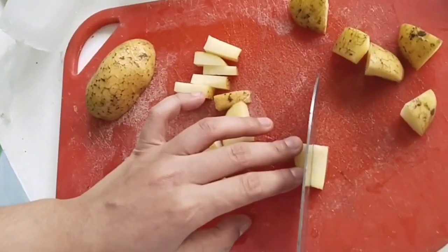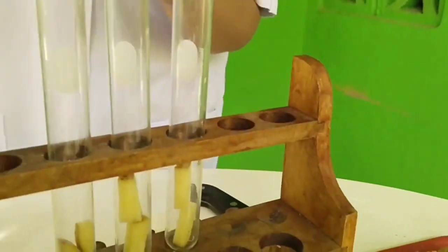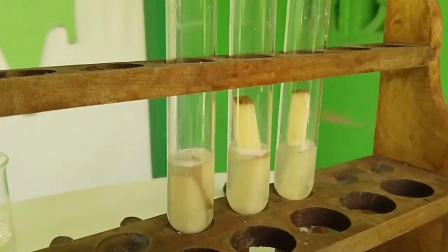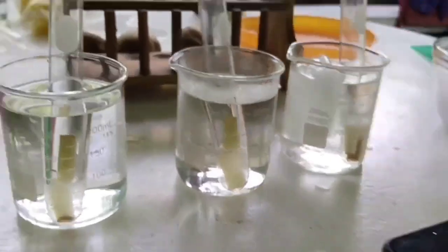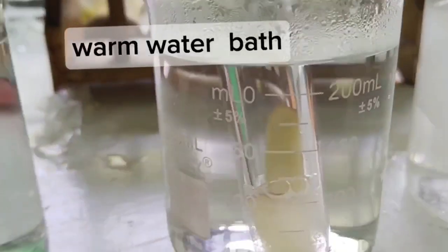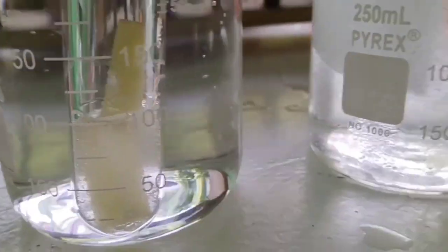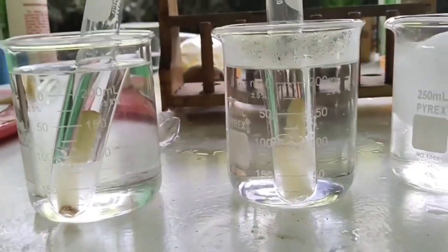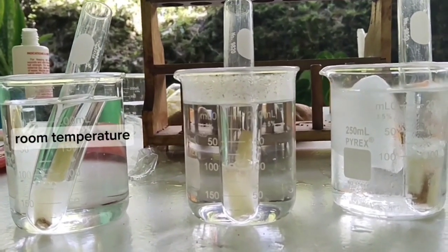Cut equal-sized potato pieces and place each piece in a test tube. Add equal amounts of hydrogen peroxide to each tube. Keep one test tube at room temperature, one in a warm water bath and another in an ice bath. Observe and measure the time taken for bubbles or oxygen gas to form for each temperature. The warm water bath usually increases the reaction rate, while cold slows it down. Extreme heat denatures the enzyme.